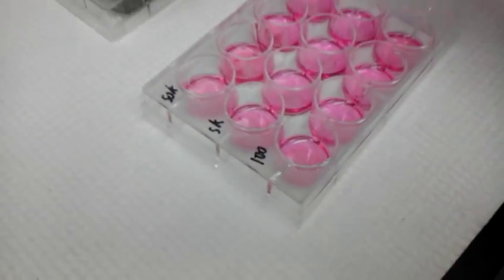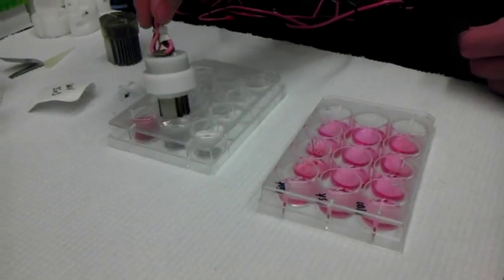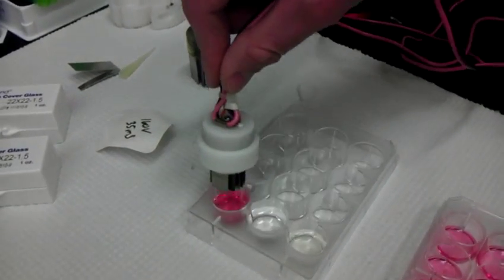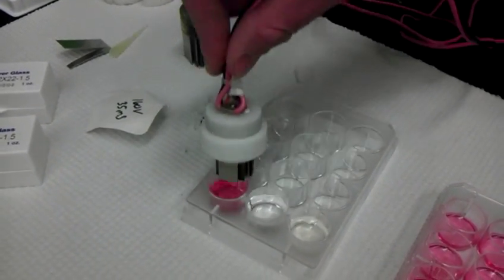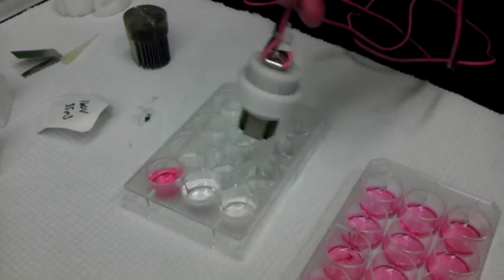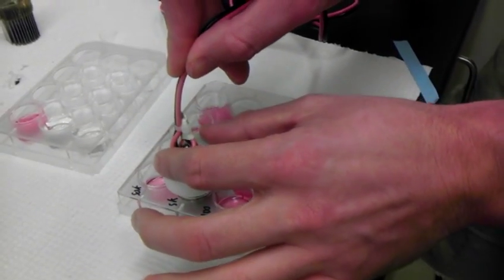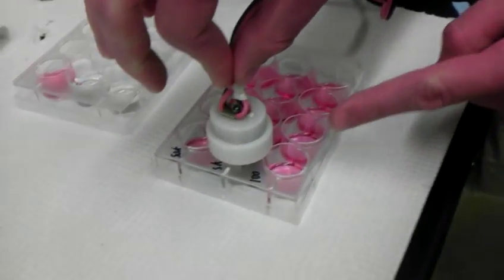So now I have to wash this. So push it up this way. So now I'm washing it in the alcohol. We're going to a new sample condition. So I'm washing it and recalibrating it in the DMEM. So I'm putting this in there.